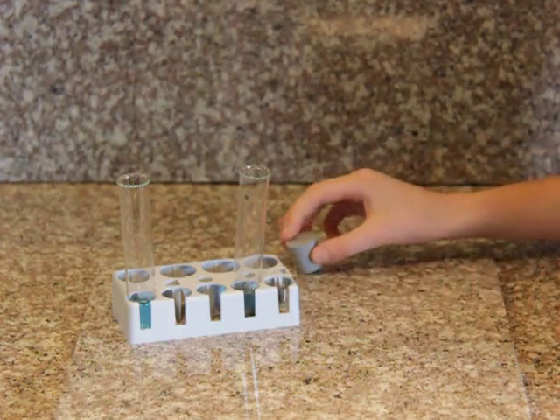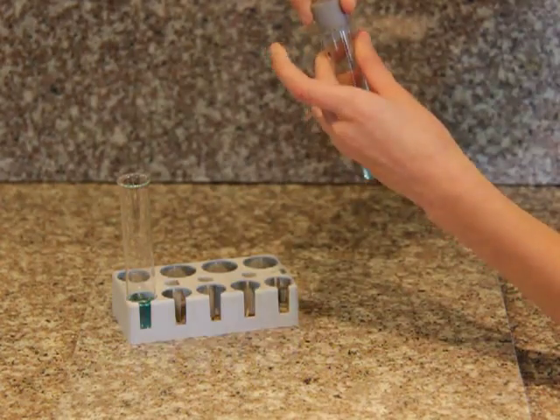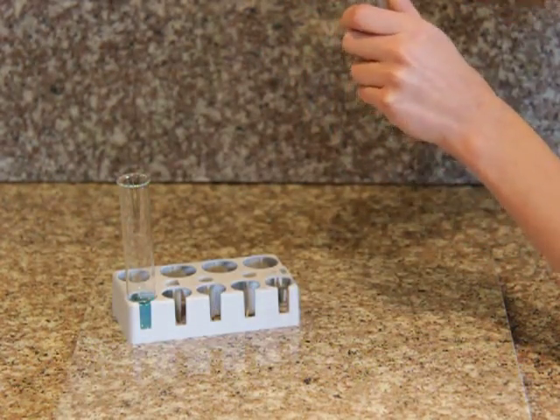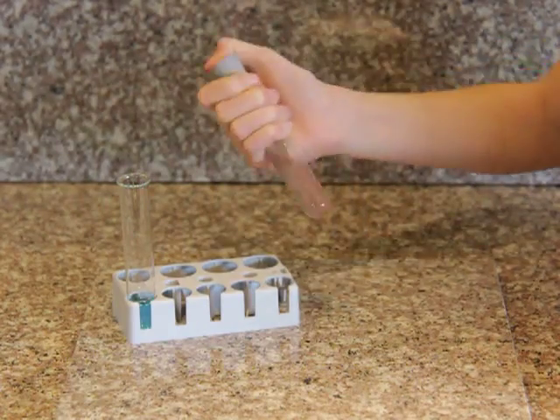And then place the test tube stopper in the test tube and then shake vigorously.